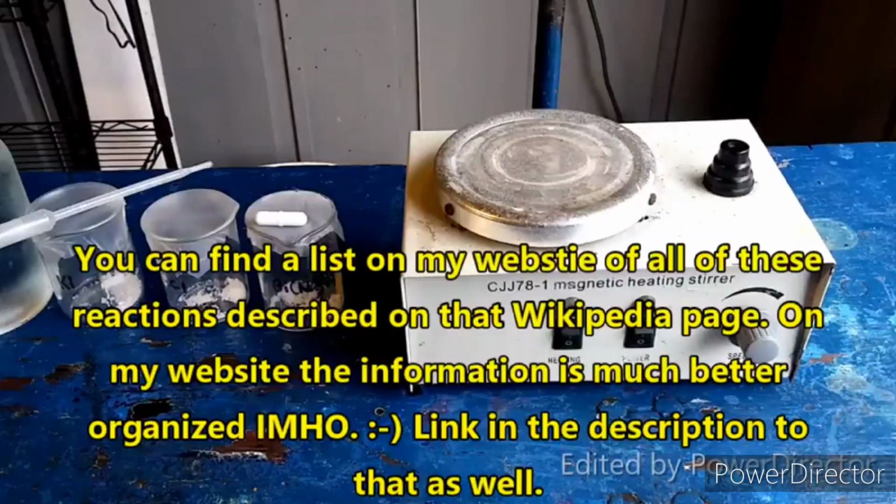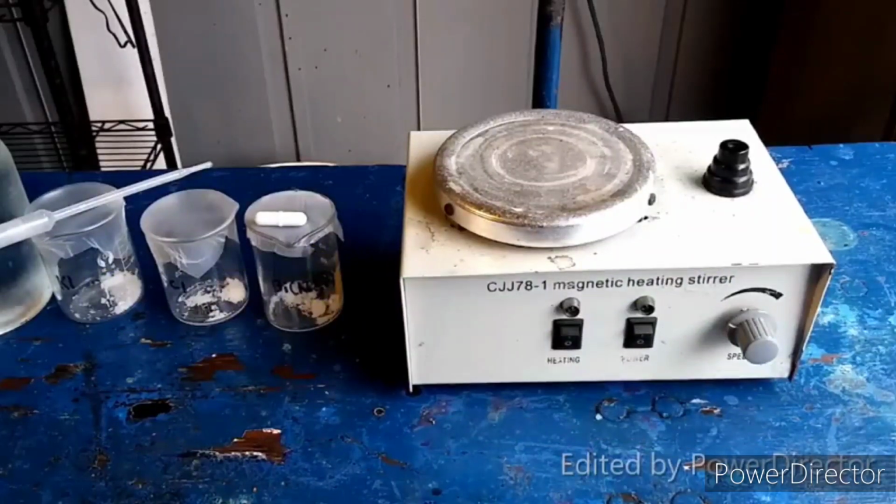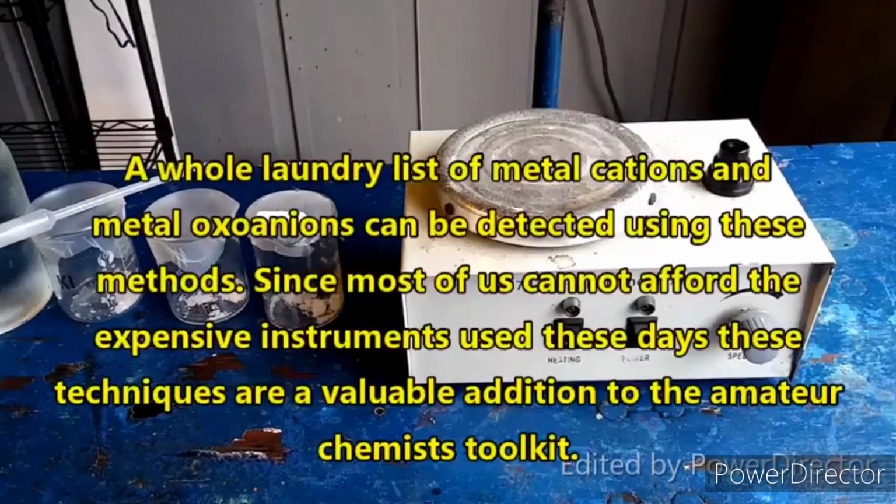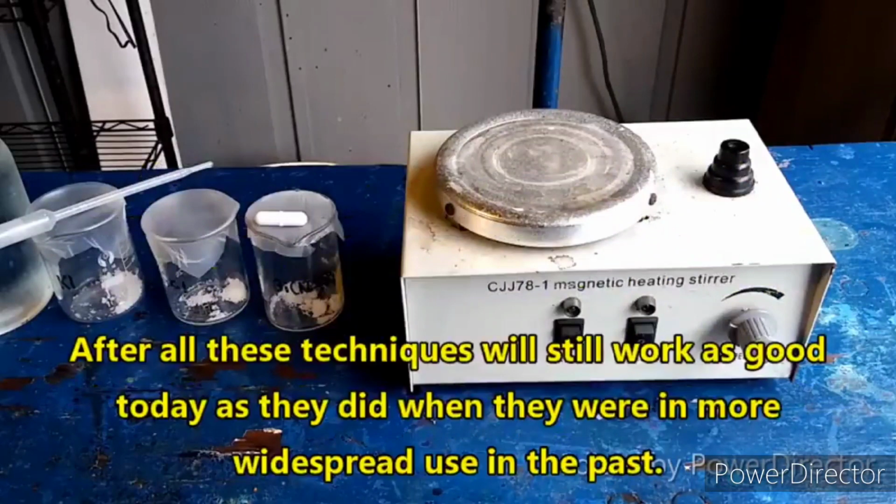Depending on what was in solution and what you used and the detection limit, it would precipitate out usually a complex, although sometimes a double salt. And you could use this precipitated solid to both identify the stuff that's present and probably measure it as well, since the solubility for all of these things is rock bottom.